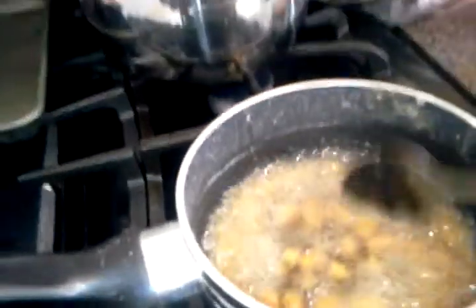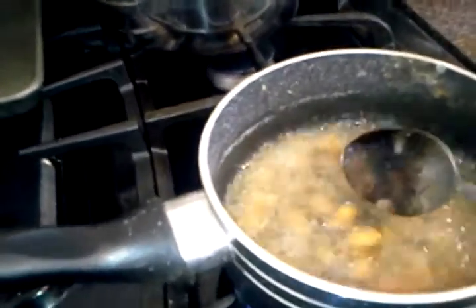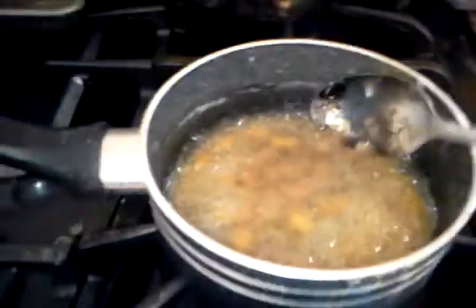This video has gone on for about six minutes and 22 seconds and it's not even fully boiled yet. I'm going to either edit this video and put in the burn rates, or make another video with the burn rates. The bubbles at a certain point start to get a golden color to them, so now you want to turn the heat down a little.